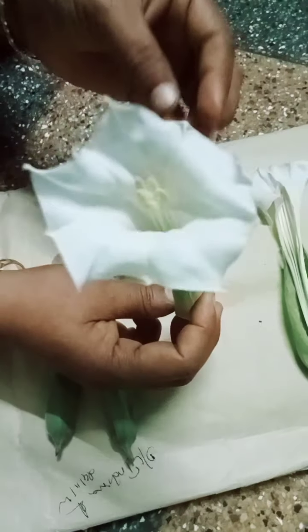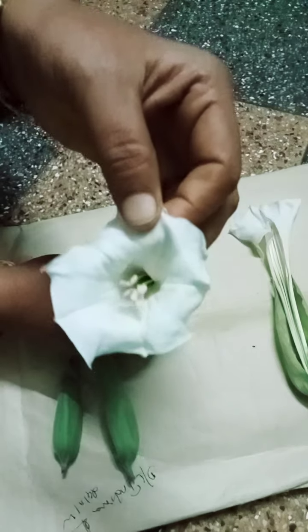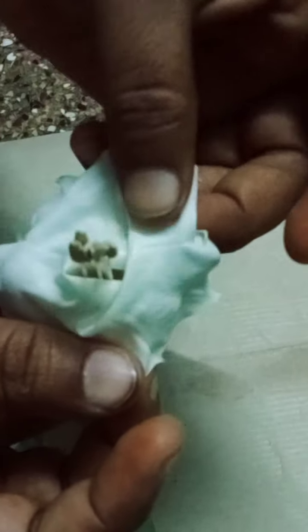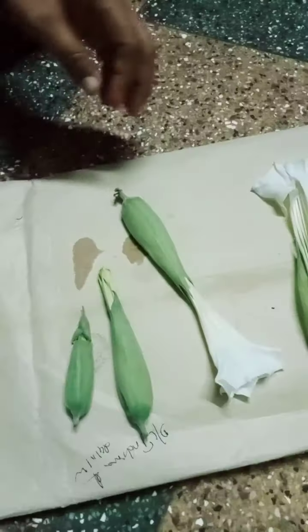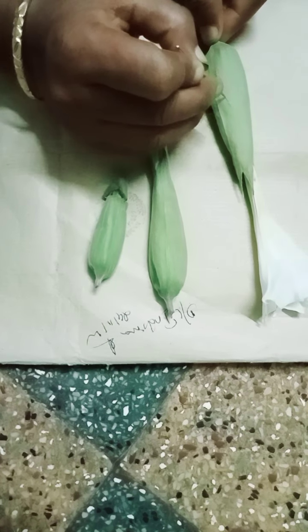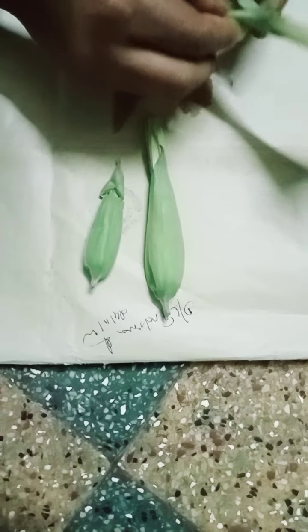This is a fully opened flower. Inside the flower you can see the male and female reproductive parts. Now we are going to dissect the flower. First, you have to peel the calyx part of the flower with a needle and open the calyx part.